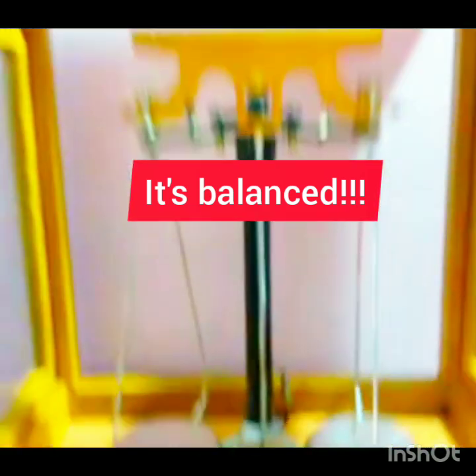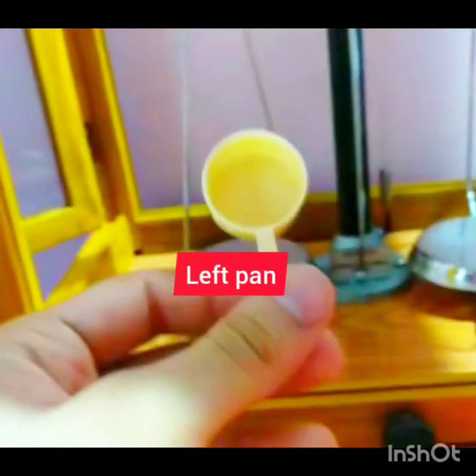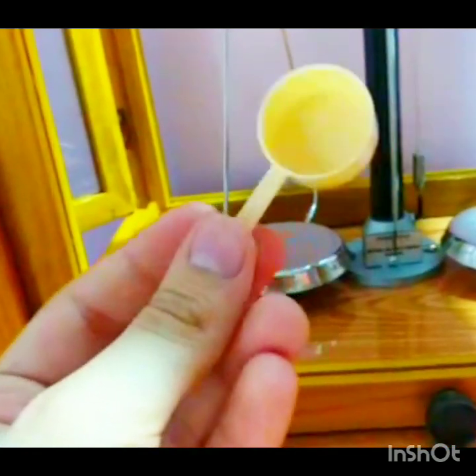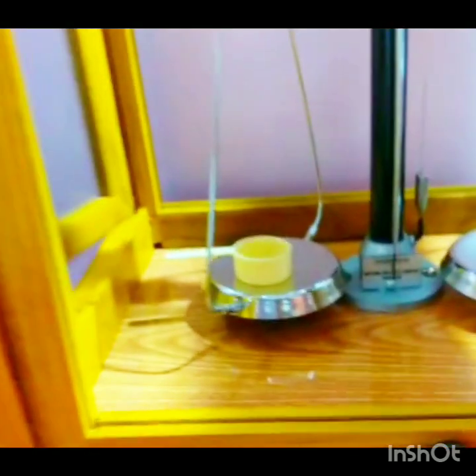After this, we need to keep our object on the left pan. This is our object. Put it on the left pan and close the door.